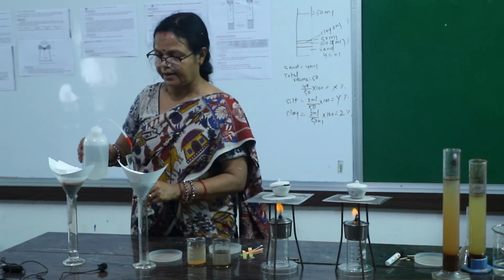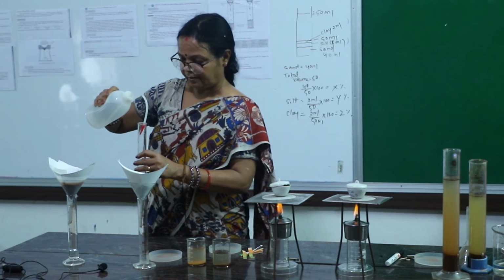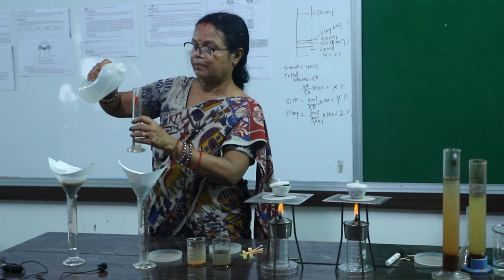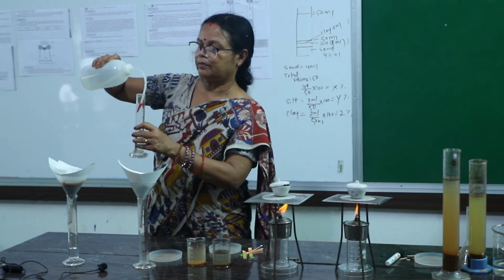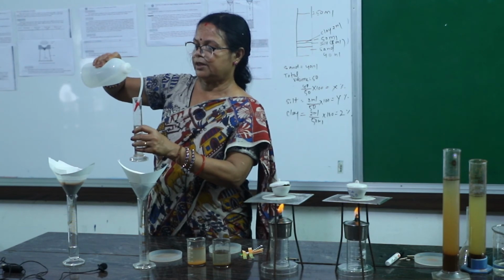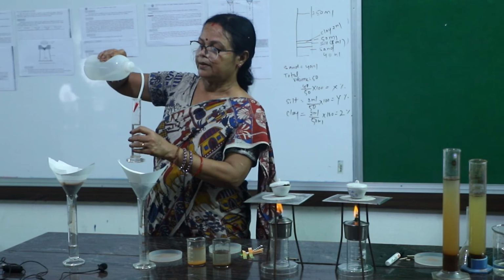Again take another 50 milliliter of water. Measurement should be taken accurately, otherwise you'll get a wrong result.